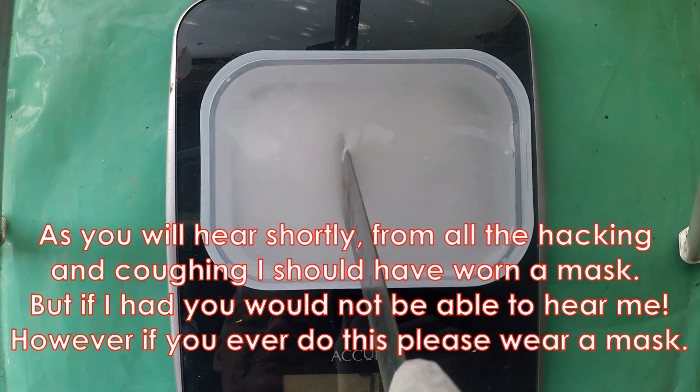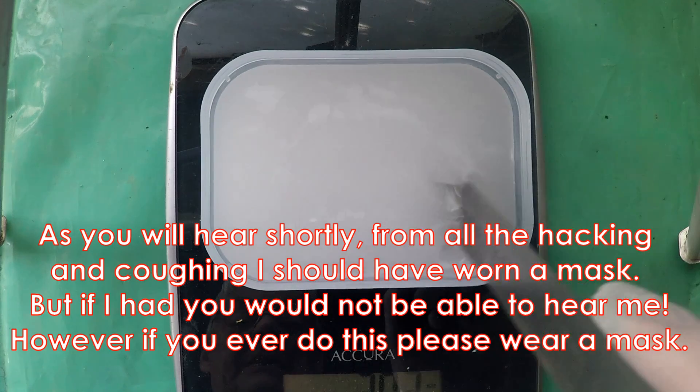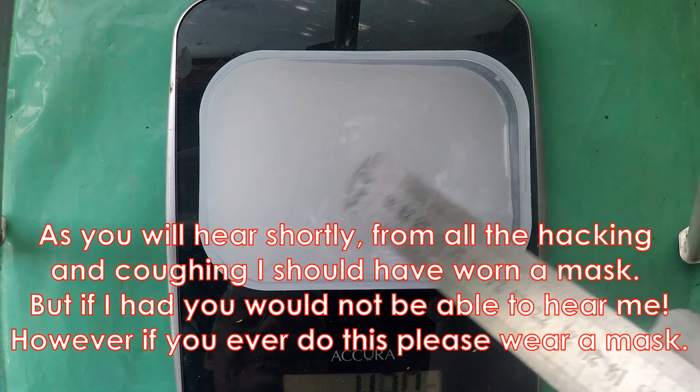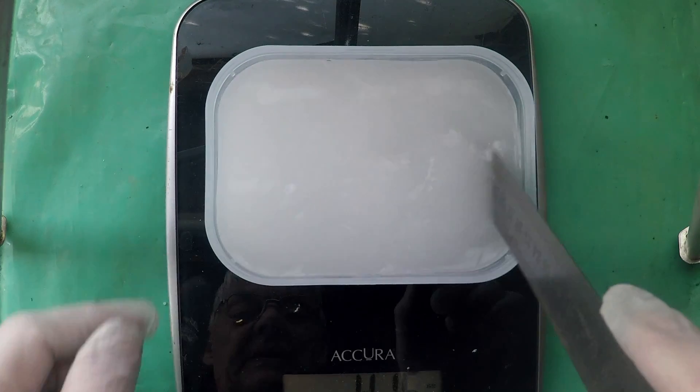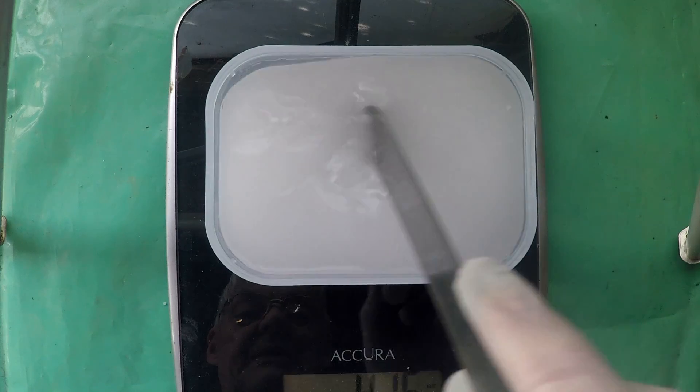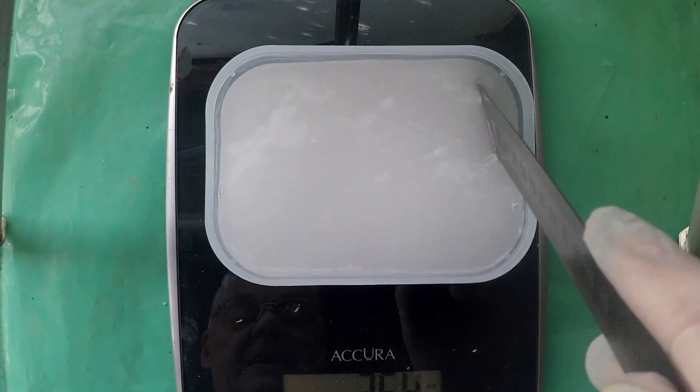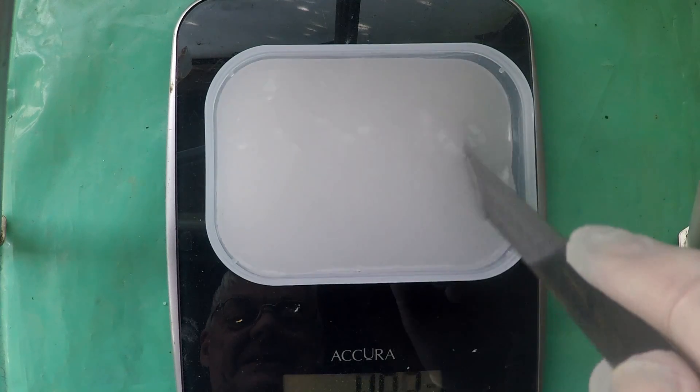I'll just stir it up a little. It dissolves quite easily usually. It goes milky to start with but then it'll come good. Still a bit there. I'm just stirring it with a stainless steel ruler here that seems as good as anything else that I could get my hands on.